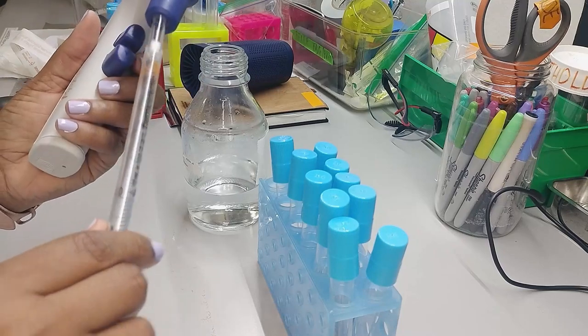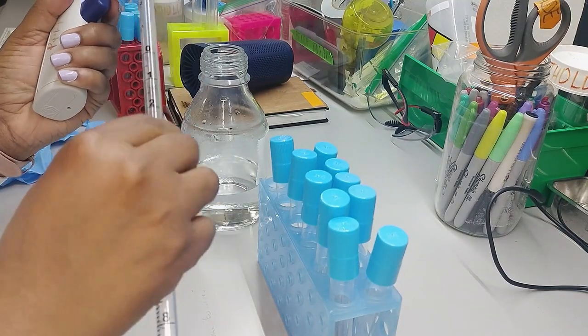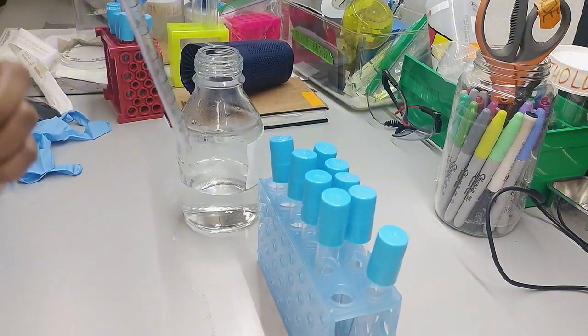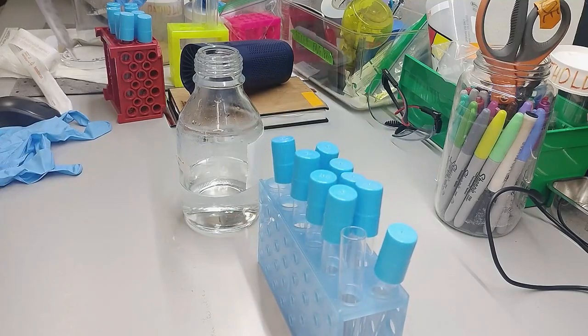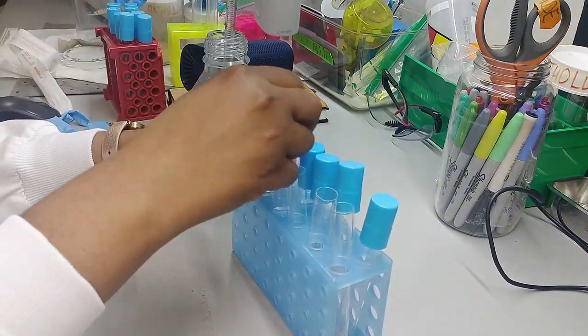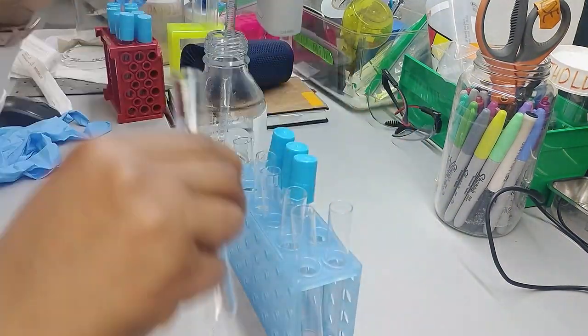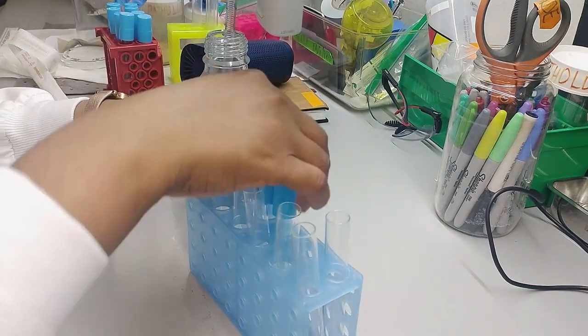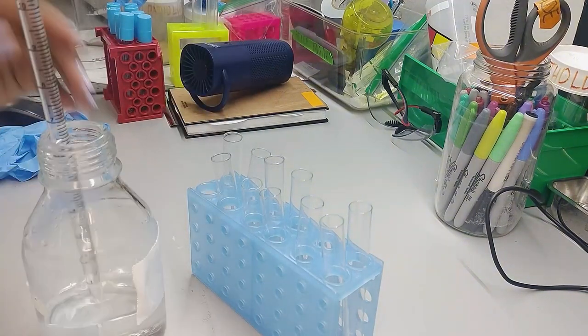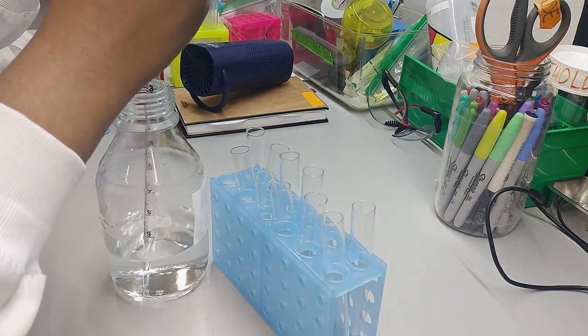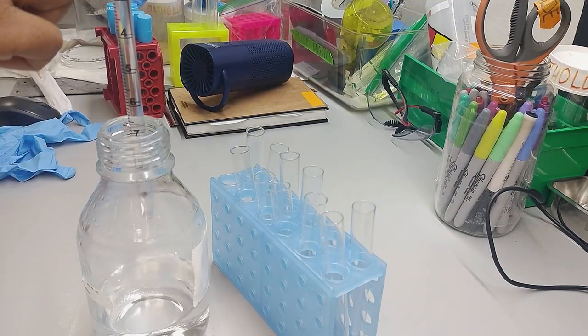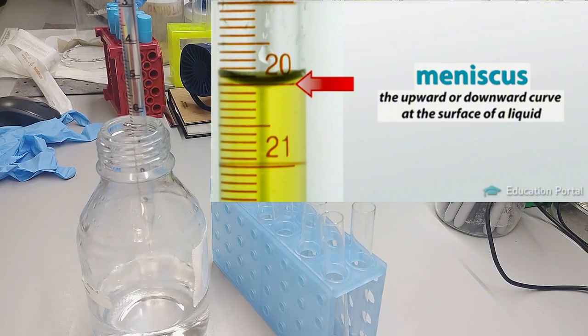I'm not wearing gloves for this part because I'm doing it outside and it is not sterile. It's probably easier to remove all the covers. Sitting right on the meniscus, there is a curvature under the bottom of the bowl.